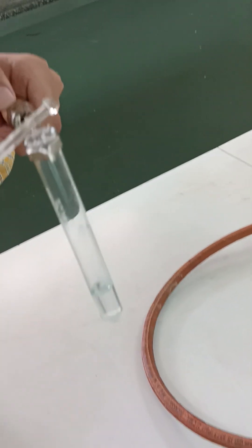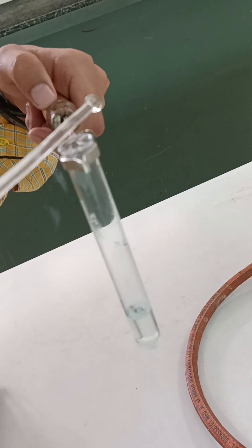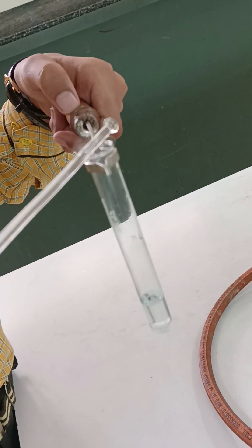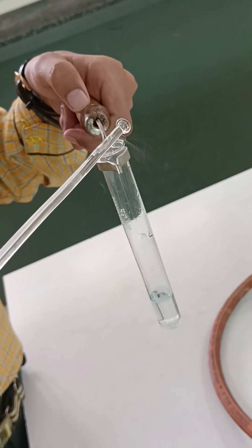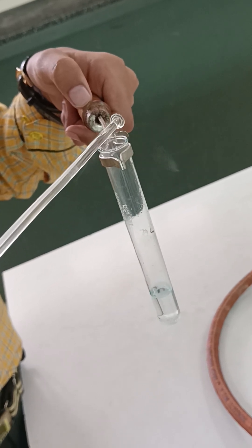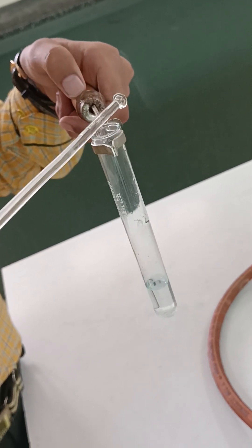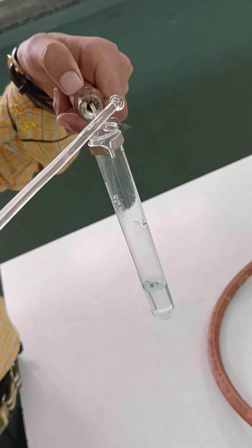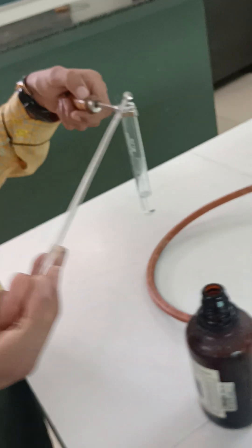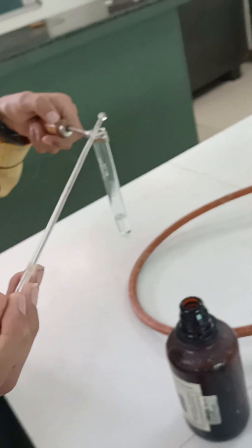Here we can see that there are some white fumes coming out of the test tube. This is due to the formation of ammonium chloride. So there is a probability for the presence of ammonium ion, which can be confirmed by the confirmatory test — Nessler's reagent test.